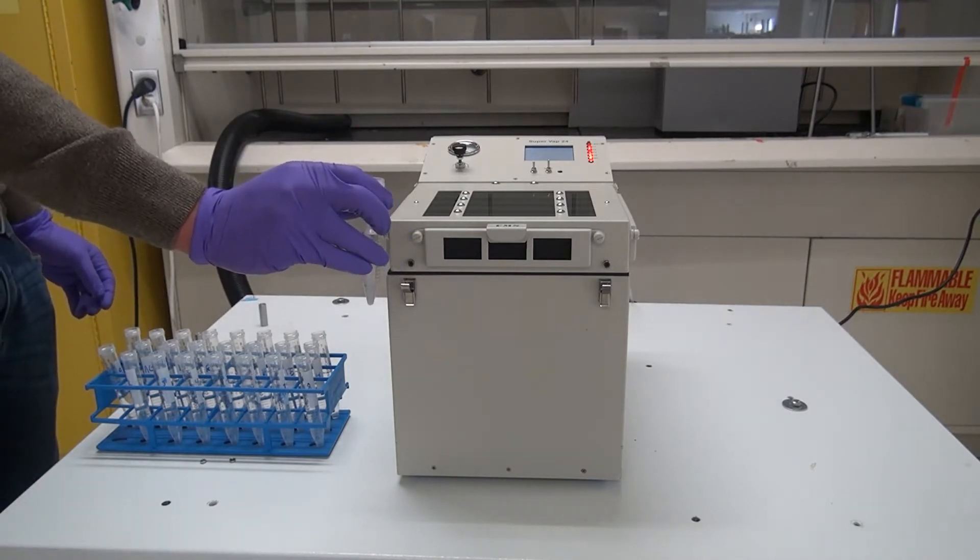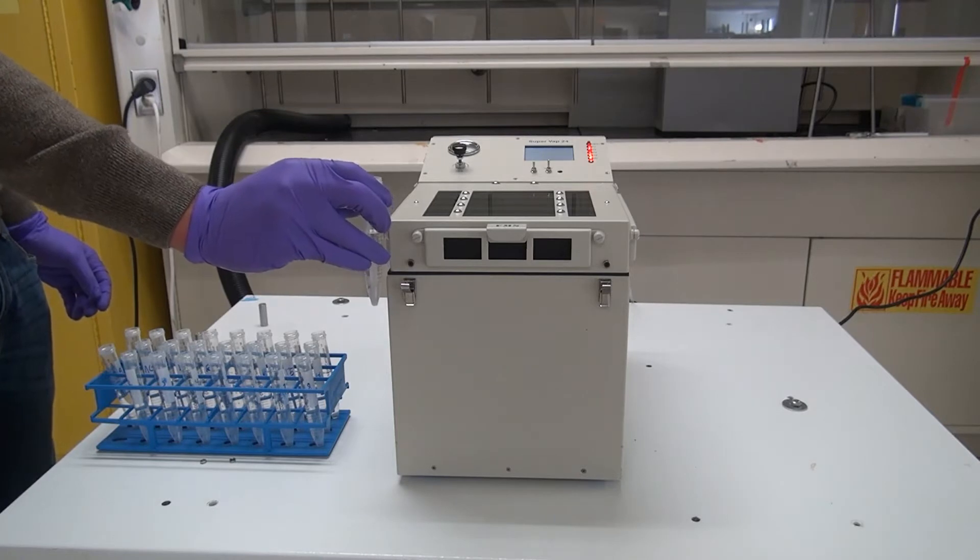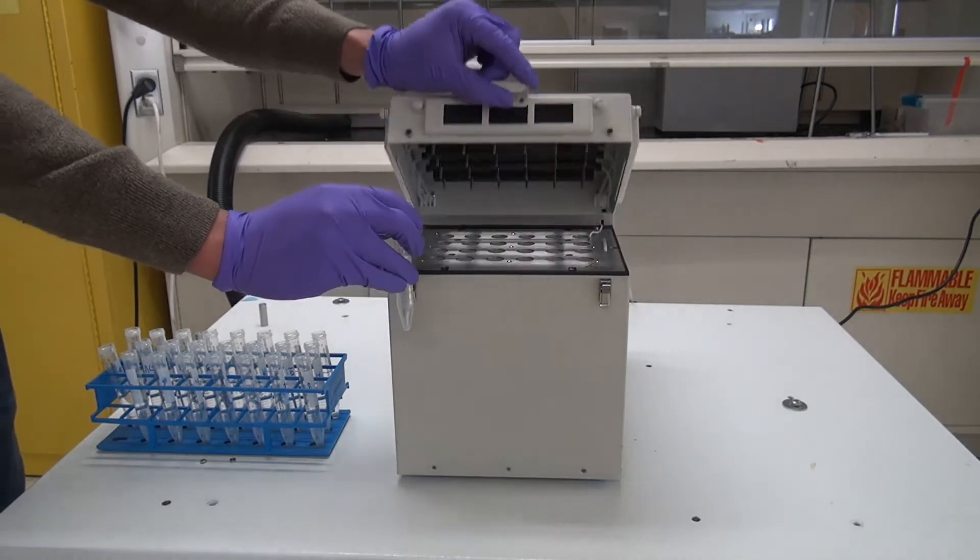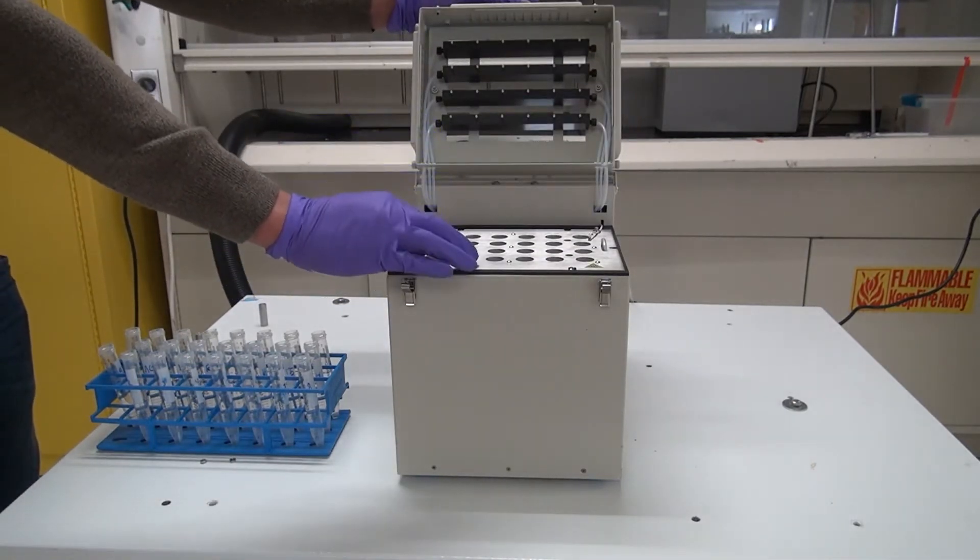The first step is we're going to lift the cover and start to put the 24 different vials in here.